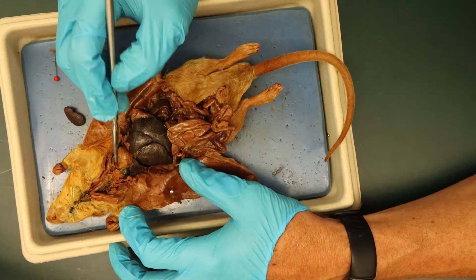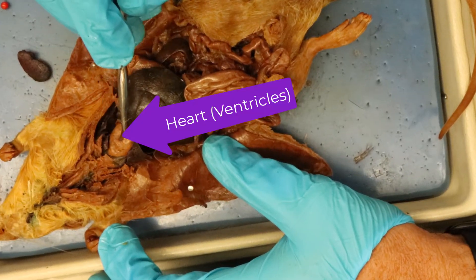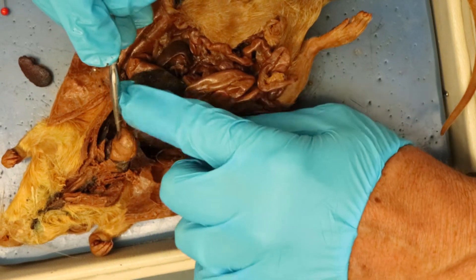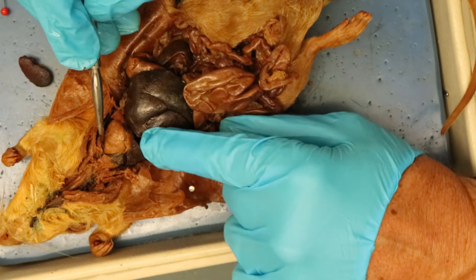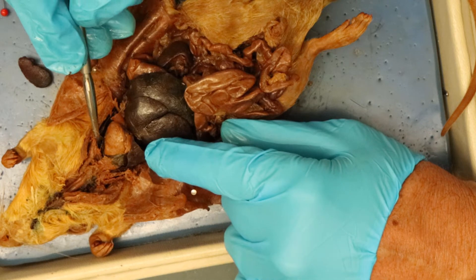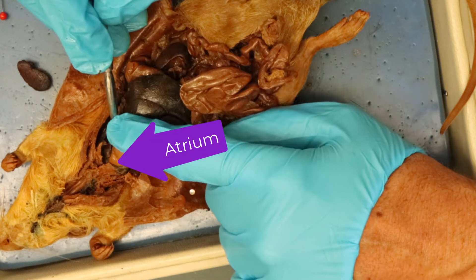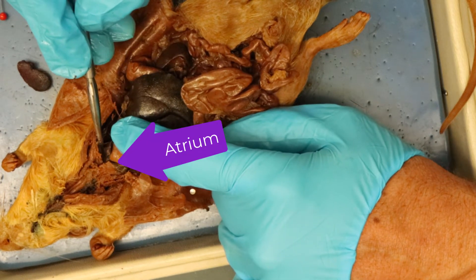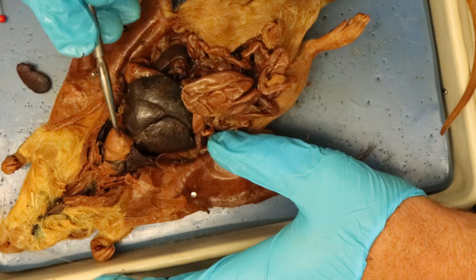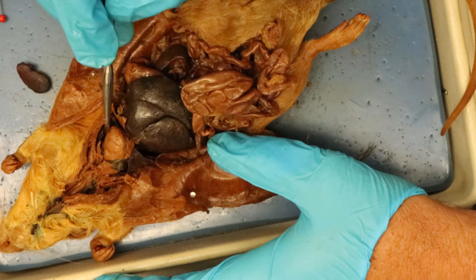Then we come down this way and we can see we have the heart right here. This is the ventricle of the heart, and this is the atrium — so this is the right atrium and the left atrium, and the two ventricles here.